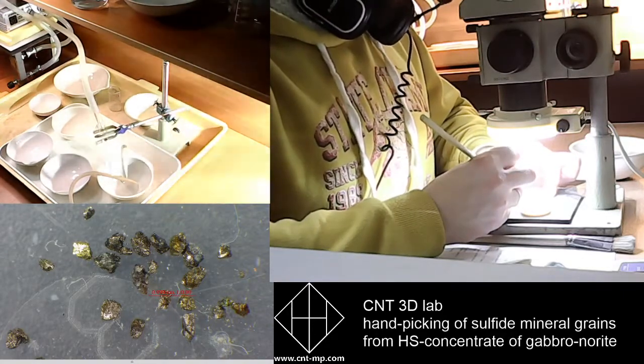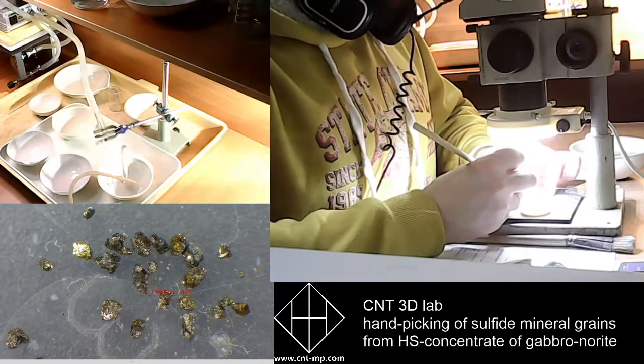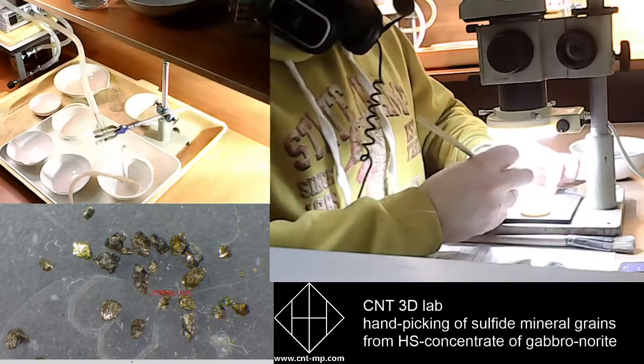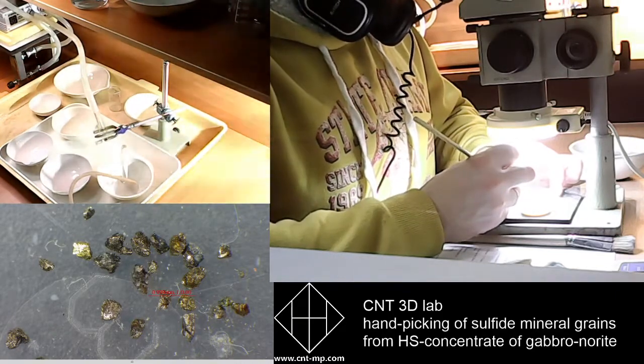I should be very accurate with every grain I collect, because they are 2 times smaller than previous fractions, so it's 2 times more difficult to extract them by hand picking, but we should still do it very carefully.